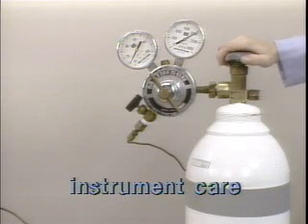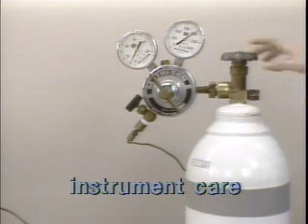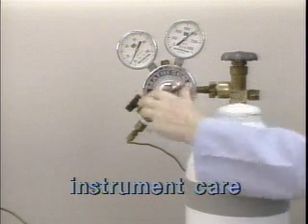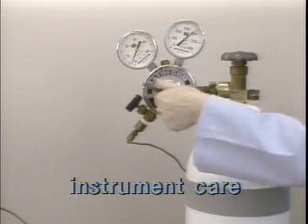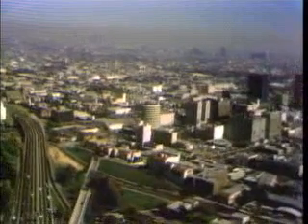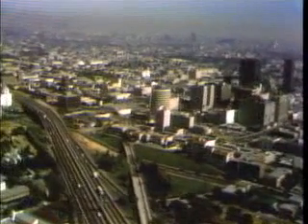Then the main valve on the gas cylinder is closed. And finally, the pressure regulator valve is turned off. The column can be removed from the oven and stored. Since gas chromatography is a simple and fast method of determination, it continues to be used in a variety of locations.